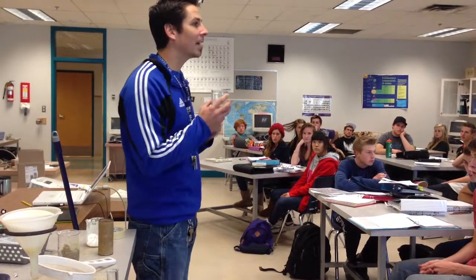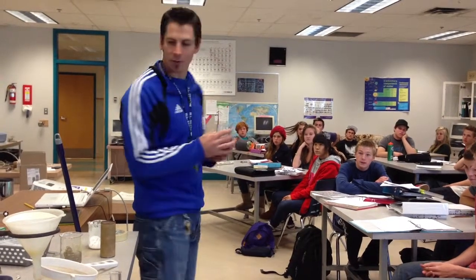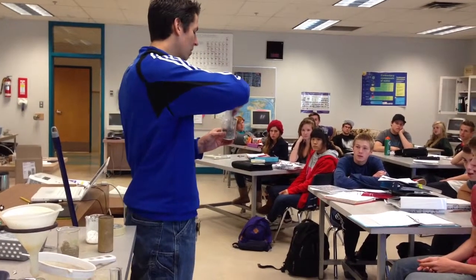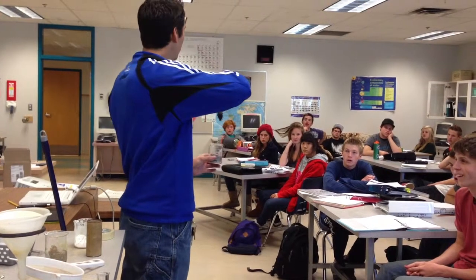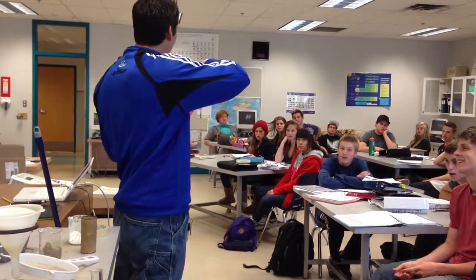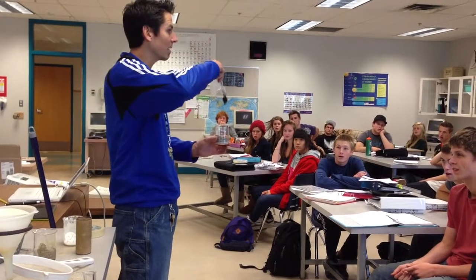What's something that iron does that most materials don't? Yeah, attract it to a magnet. And so I can take a magnet and I can just stir it around here and I'll pull out the iron filings. Okay? And so I use the property of magnetism to allow me to separate those materials from each other.